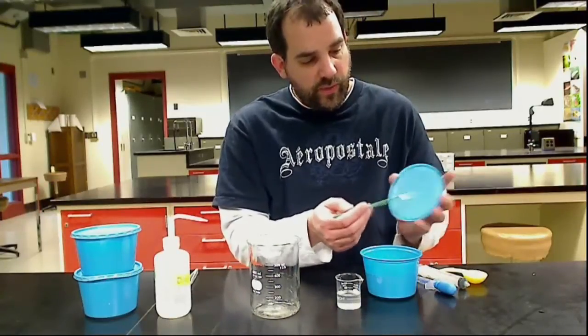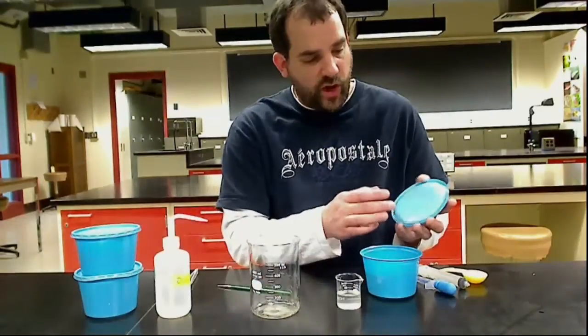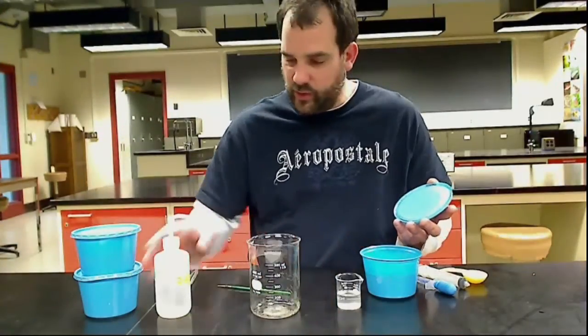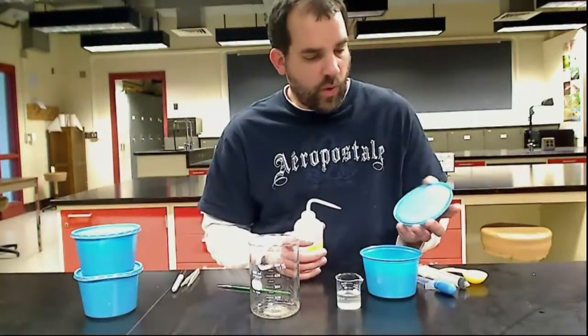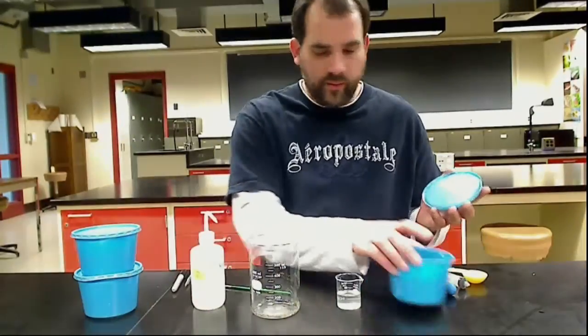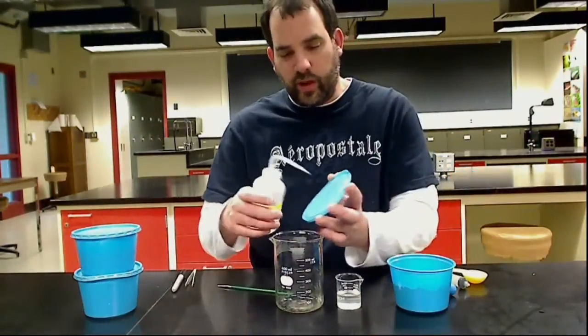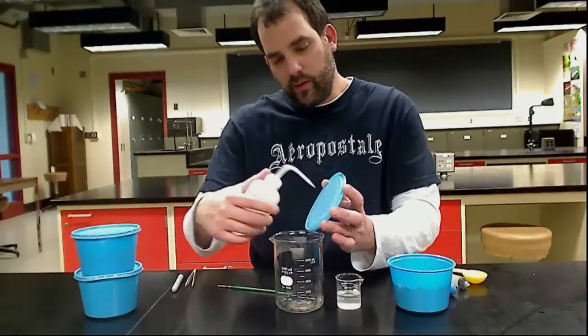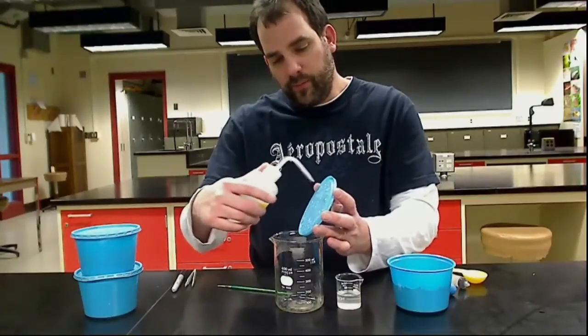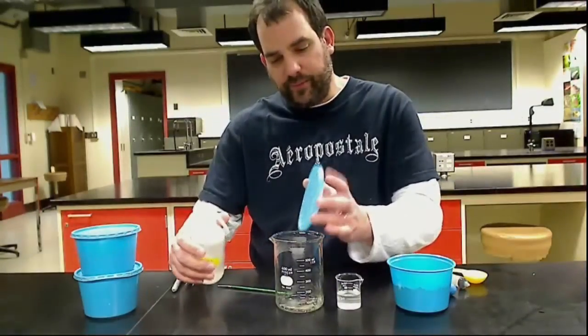You can also do it if there's a lot of nematodes on the lid. You can take your water and actually rinse your lid into another container to collect all the IJs that are on that lid.